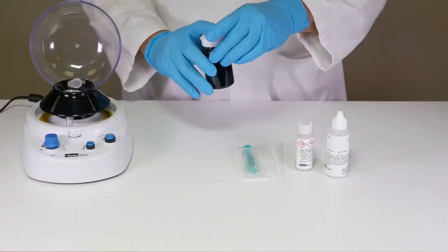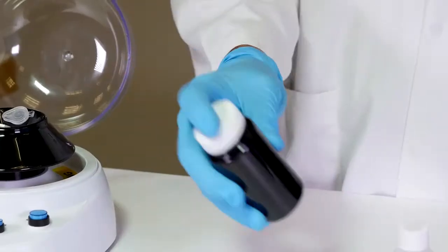Prepare your heavy fuel oil sample with some gentle agitation for approximately 30 seconds.